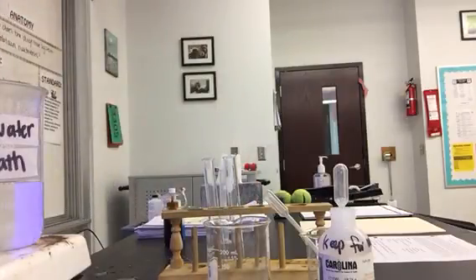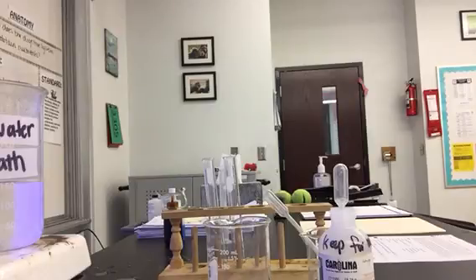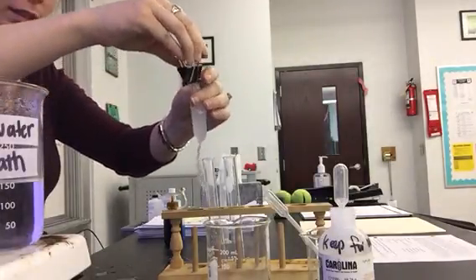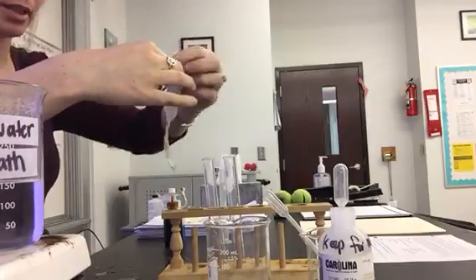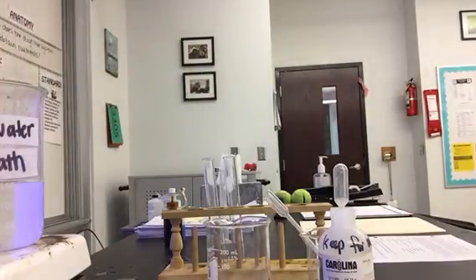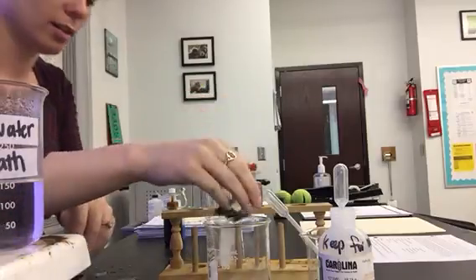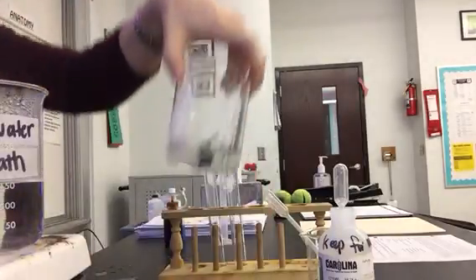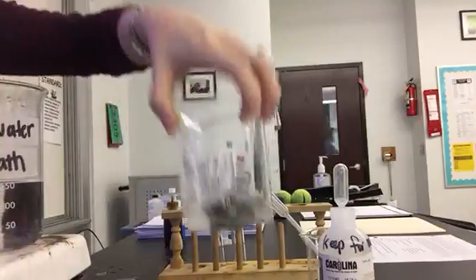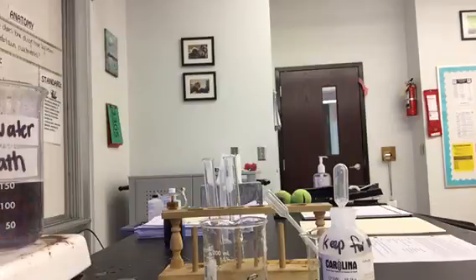I'm going to put a clip on this because I used such a small piece of dialysis tubing — probably a little bit too short, but that's okay, we'll make it work. I'm going to rinse it off in the sink because I don't want anything that is supposed to be on the inside to accidentally end up on the outside of the bag. It's just going to sit in the bottom of the container for about a half hour, and then we're going to test for the presence of starch and glucose in the water on the outside of the bag to see if anything left.